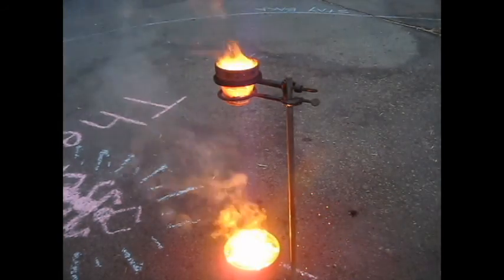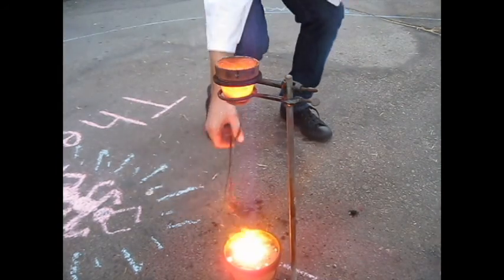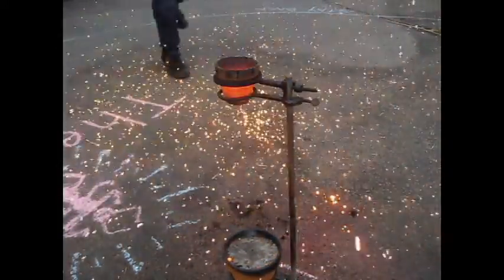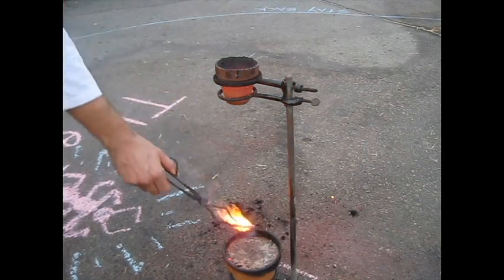It came out the bottom. We've got a huge amount of product here. Okay, glowing like lava. Pour some out maybe. Wow, it's spectacular. Look at this glowing product from the demo.